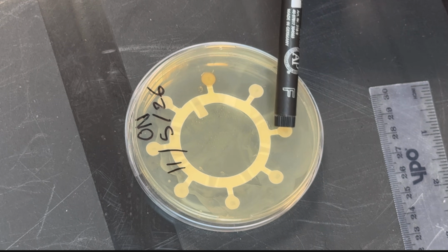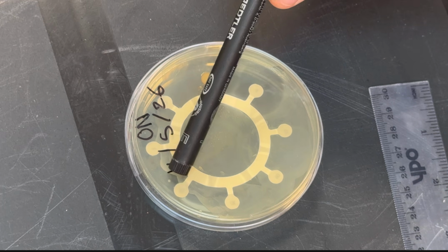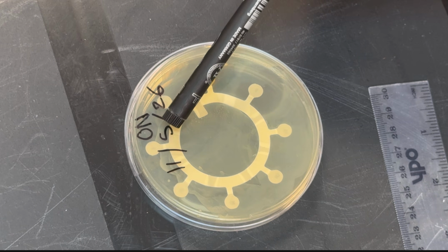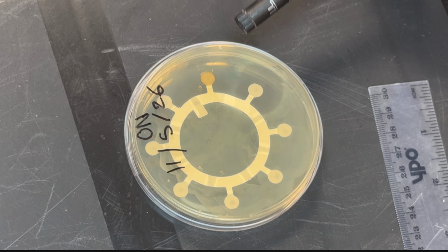Okay, there is a slight shade in this one, and the other ones don't almost show anything. Okay, so we have three clear rings here. So I will show in this one that is best to see in the video how to make the calculation.